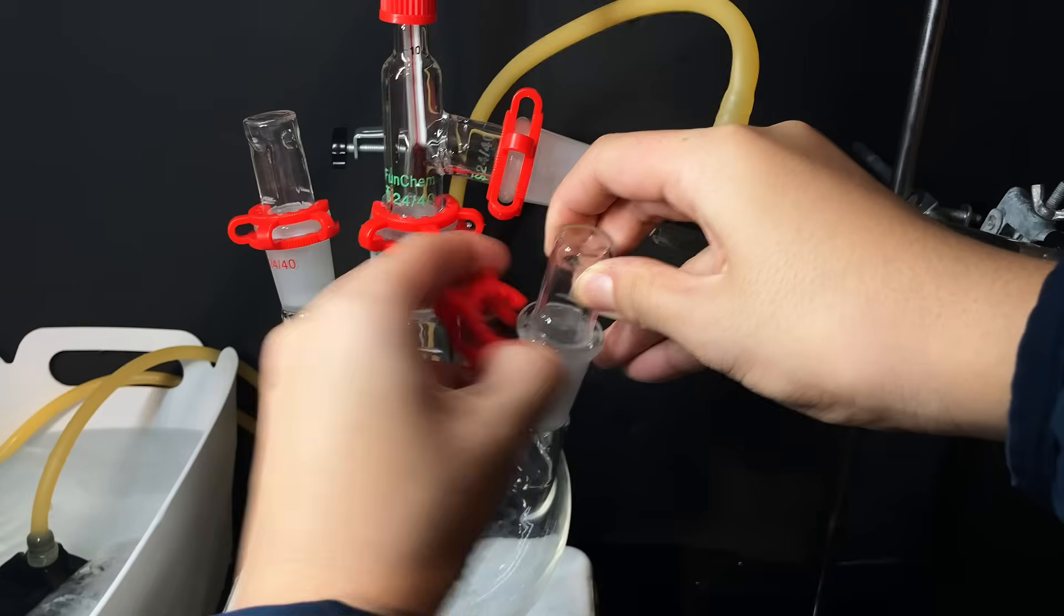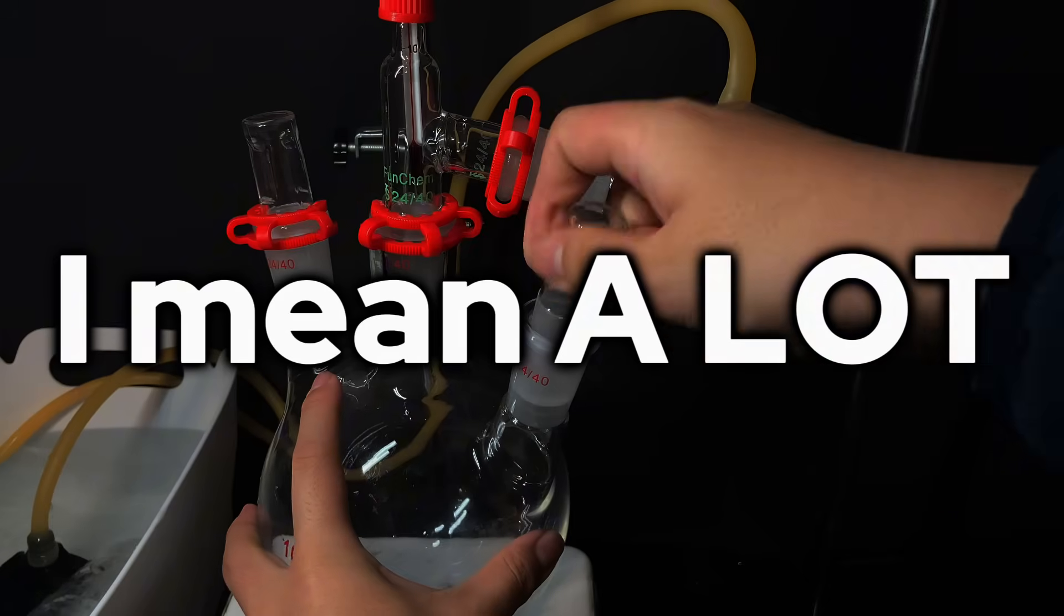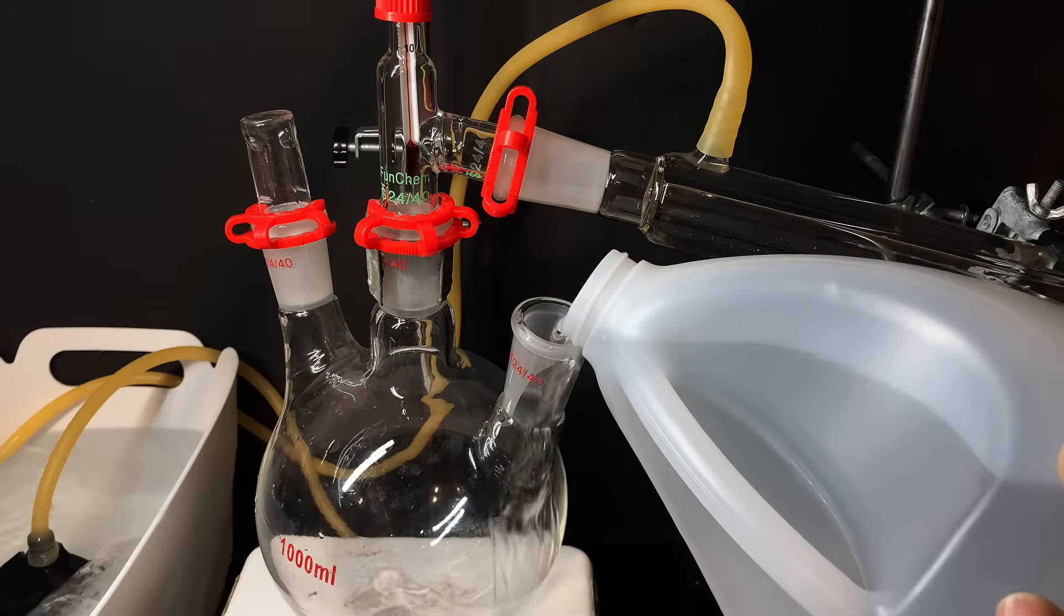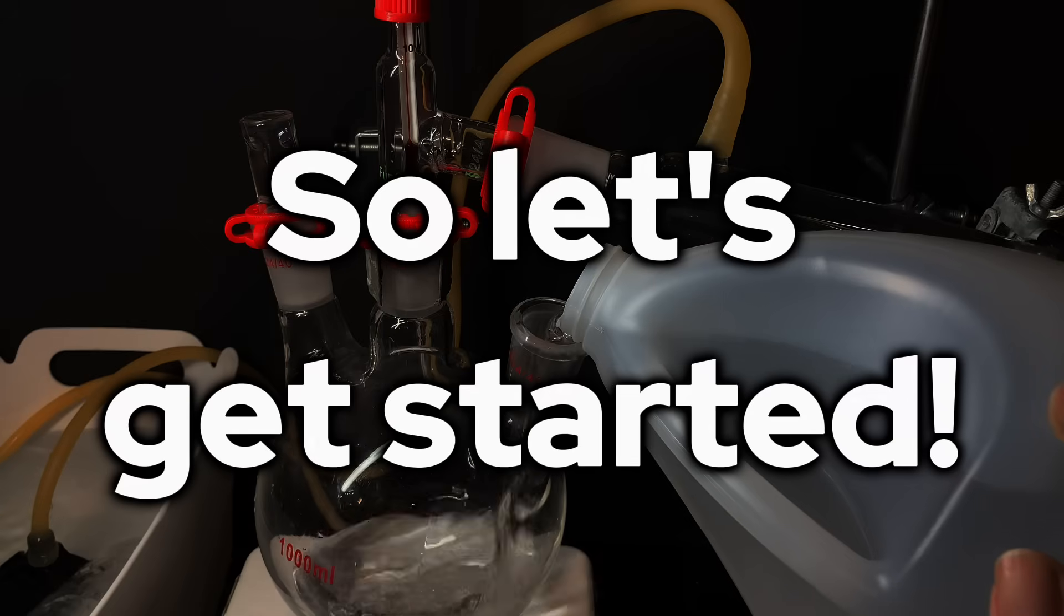In this video I'll be extracting it from sanitizer, and my main goal is to get so much anhydrous ethanol that I'll never have to worry about it again, like I mean multiple liters. So let's get started.